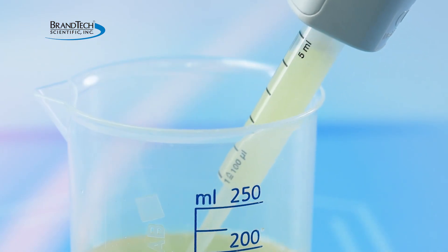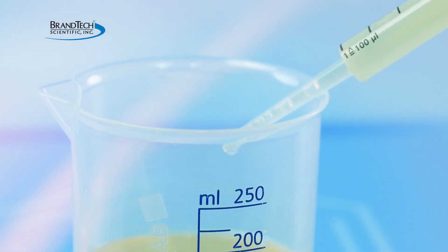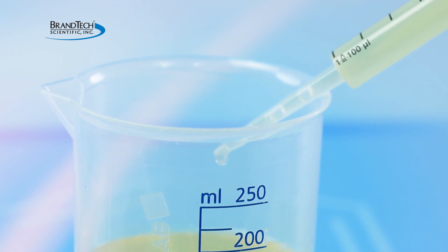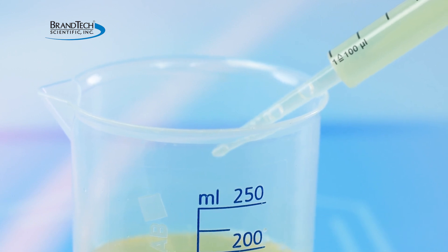Pushing the piston back too quickly, especially with larger volume PD tips, can cause cavitation or creation of bubbles in the PD tip. This is especially important when working with viscous liquids. Excessive bubbles in the PD tip can cause inaccuracies in the HandyStep S.